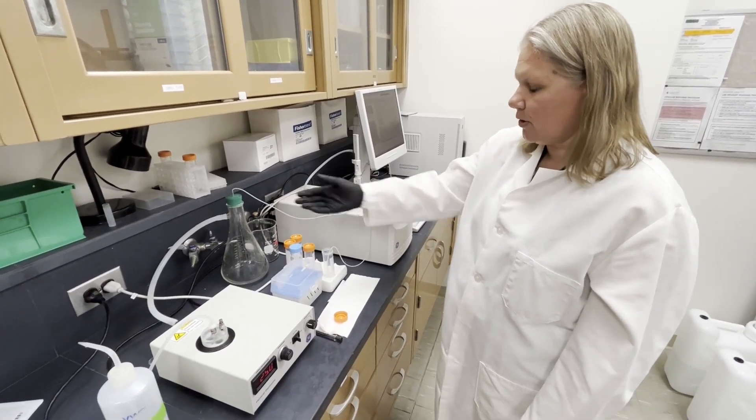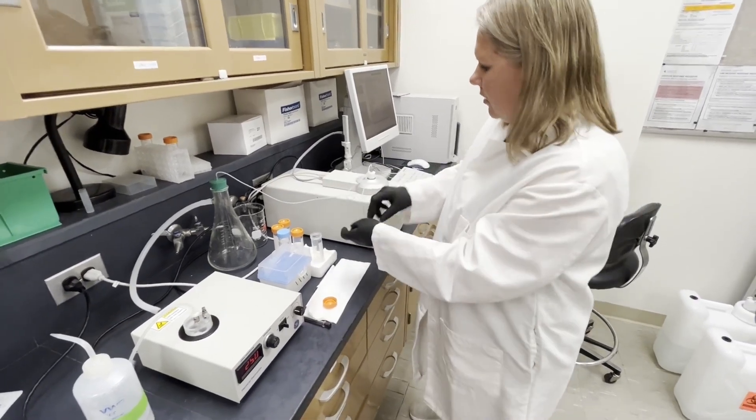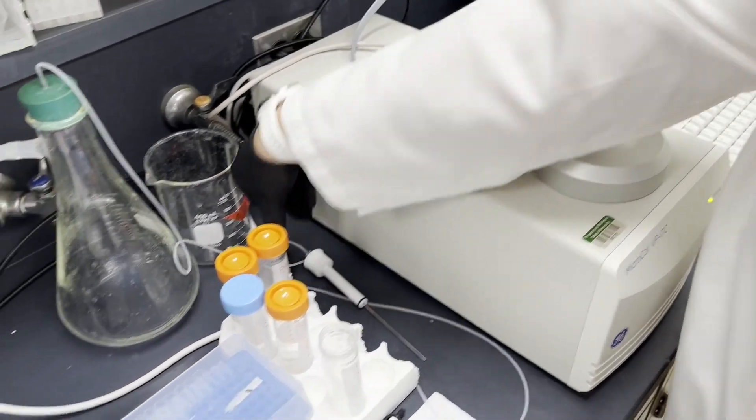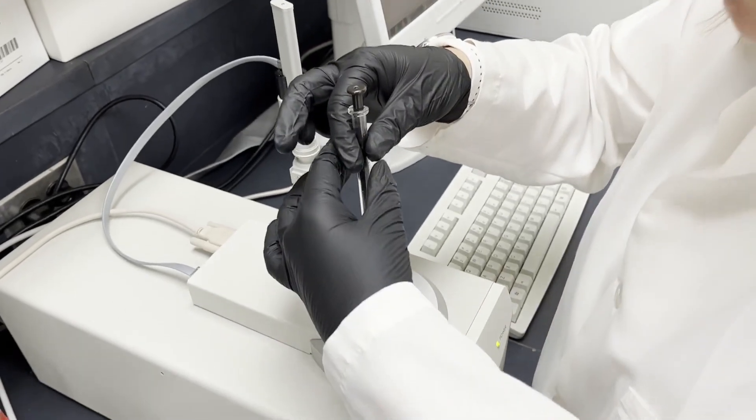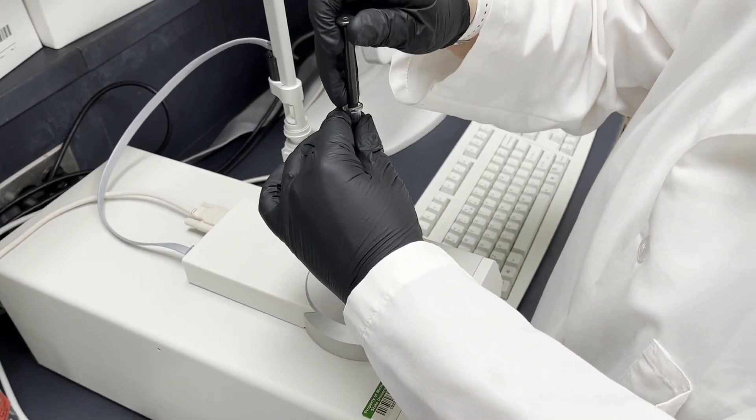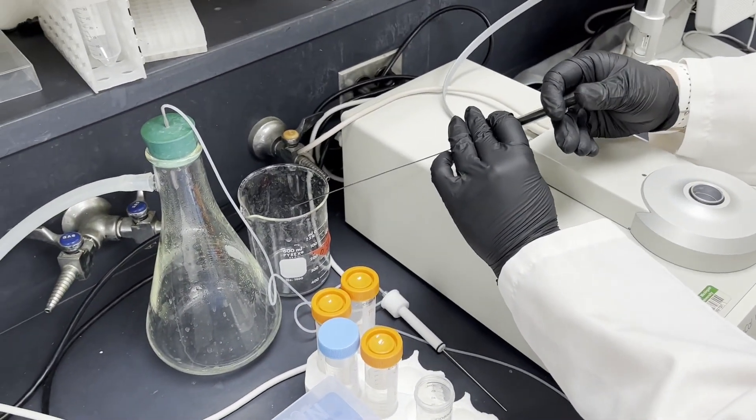Now there's pretty much air in there. I'll turn this off. We can double check that all of the liquid is out using our Hamilton syringe. That just, you want to make sure you get rid of your residual buffer.